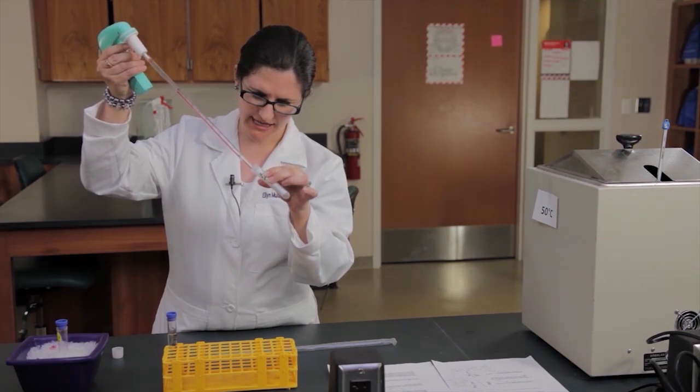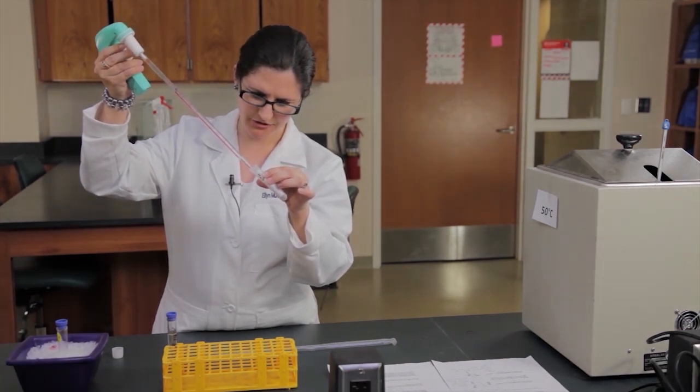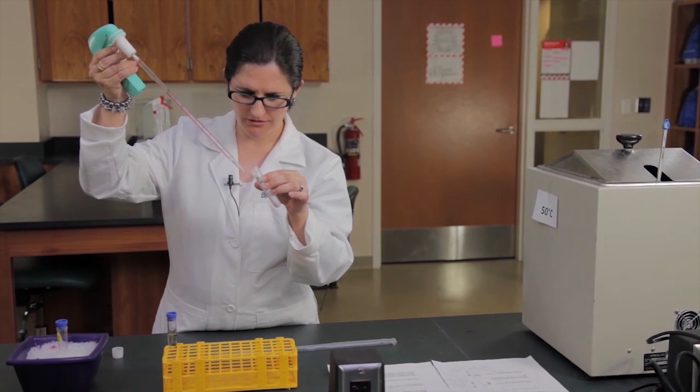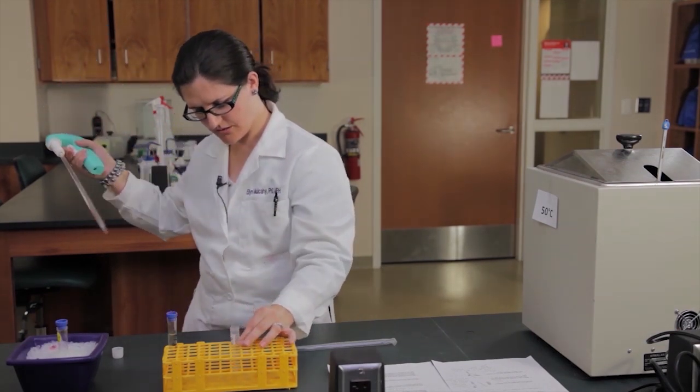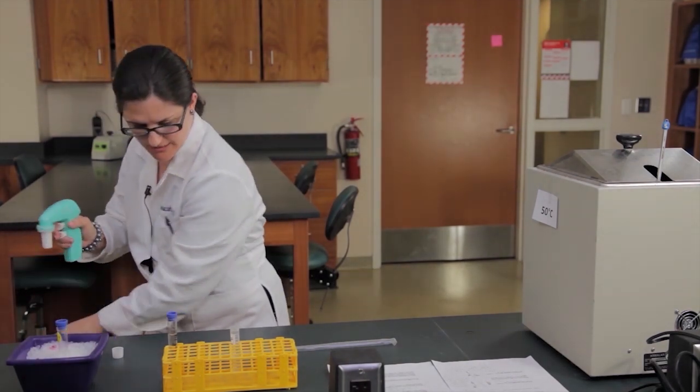The combination of the alcohol plus the lysis buffer will allow the DNA to come out of solution so that we can visualize it.